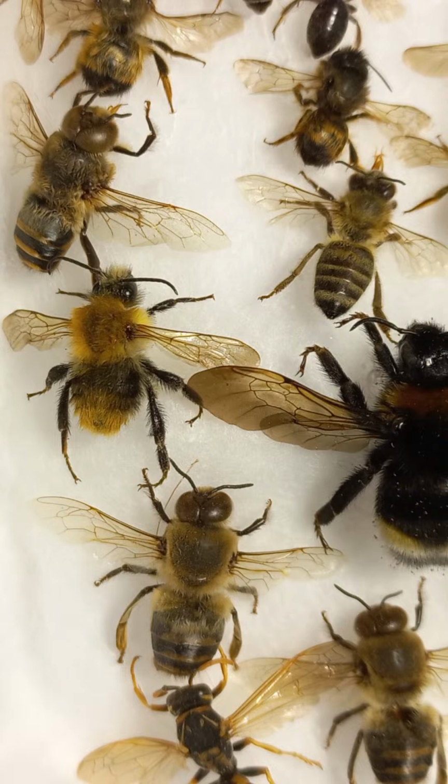The middle section of a honeybee is the thorax. The thorax contains the muscles that control the 2 pairs of wings. The other muscles control the 3 pairs of legs. The legs have specialized structures and very special hairs on them that assist the honeybee in cleaning itself and in collecting and carrying pollen.